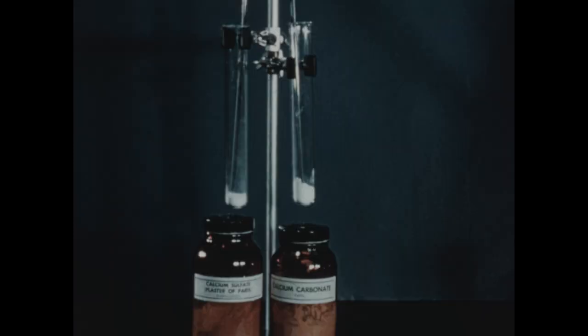A few moments ago, we saw that where sugar wouldn't dissolve in alcohol, by adding water to the alcohol, we caused the sugar to go into solution. Now here we see the thing in reverse. The rosin did dissolve in the alcohol, but then when we added the alcohol to water, the mixture is not a good solvent for rosin, and the rosin is precipitated.